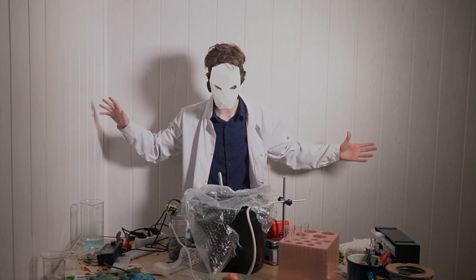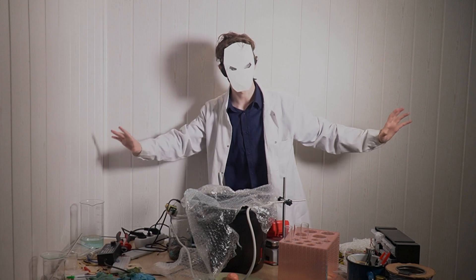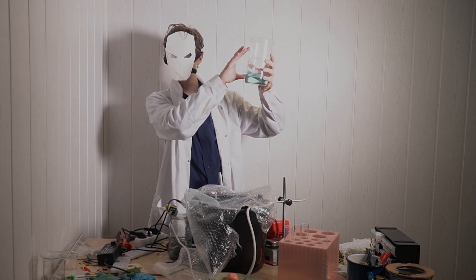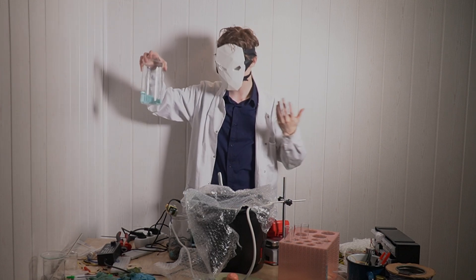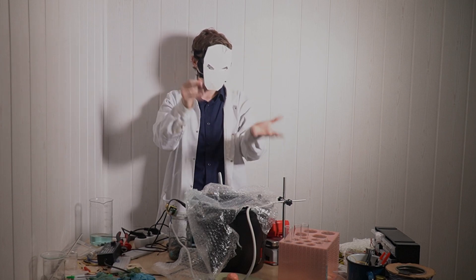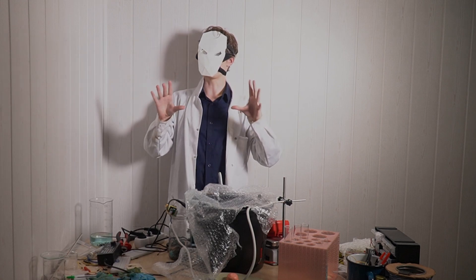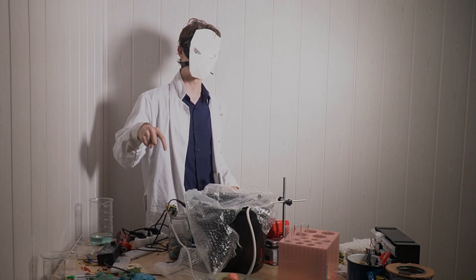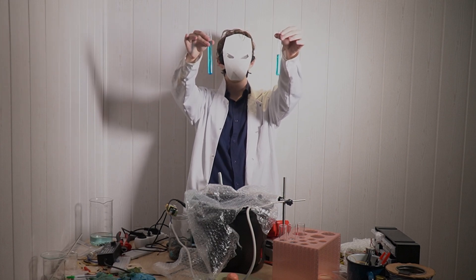There have been some complications. There's no more time-lapse. The last thing we made is not exactly right — it's blue, which it shouldn't be. It was clear, but then when I came back to it, it had turned blue because there was still clearly some copper left. Also there's a gas coming out — I'm pretty certain it's either sulfur dioxide or sulfur trioxide, both of which are pretty bad. And right here there is a diode blinking — it shouldn't be blinking. One of these has been electrolyzing for a week. Can you tell which one?